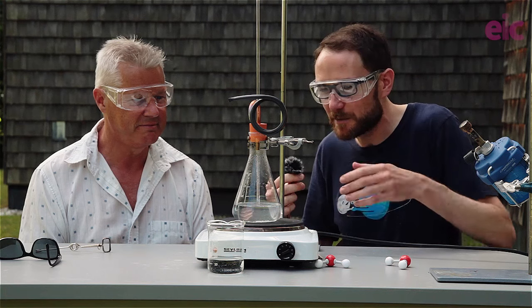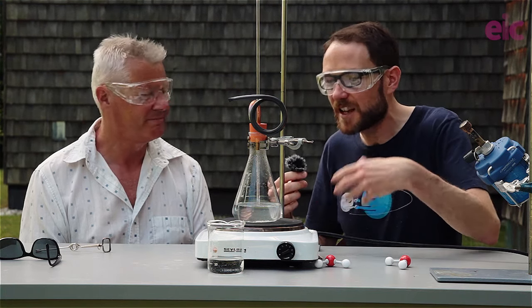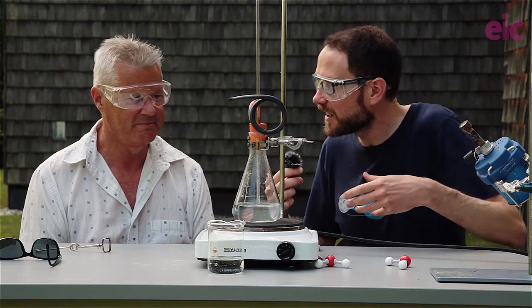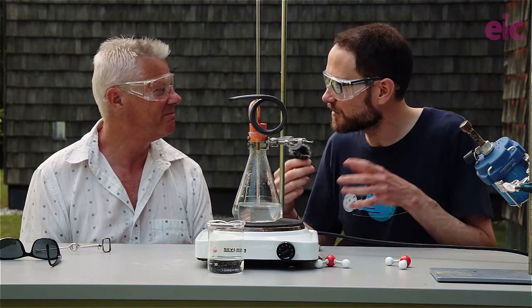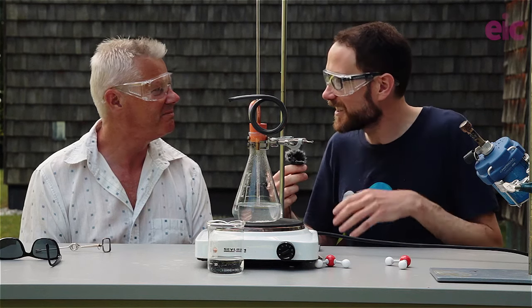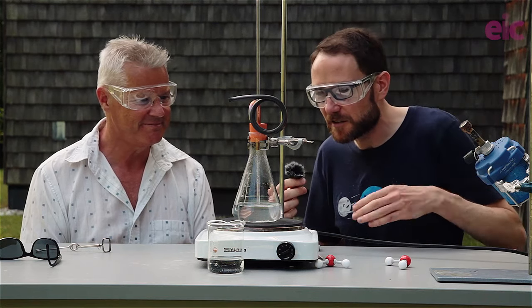And the white stuff that's in there, those are boiling chips. They're basically to help, as we begin to heat this up, we're going to start boiling the liquid, and it's going to boil a little bit more smoothly, a little bit like sticking raisins inside. Have you ever stuck raisins inside a fizzy pop and watch them dancing up and down? You should try that. It's awesome. Okay, so they'll start dancing around in there just to help that going off smoothly.